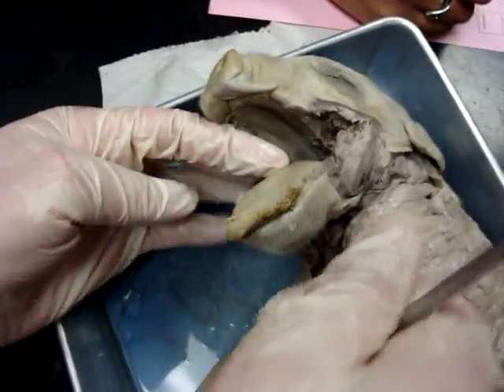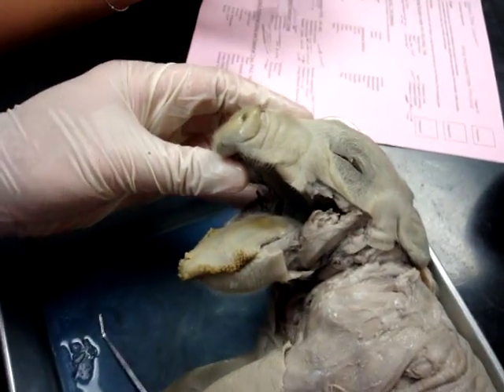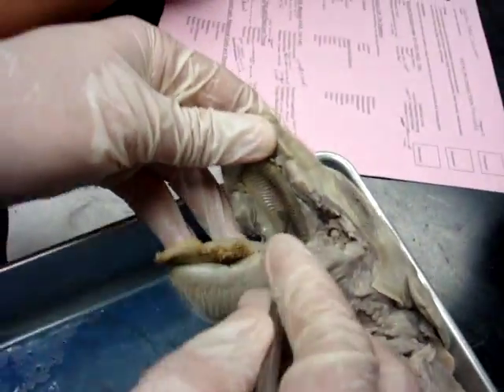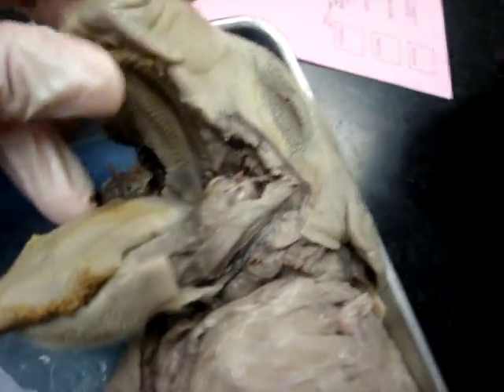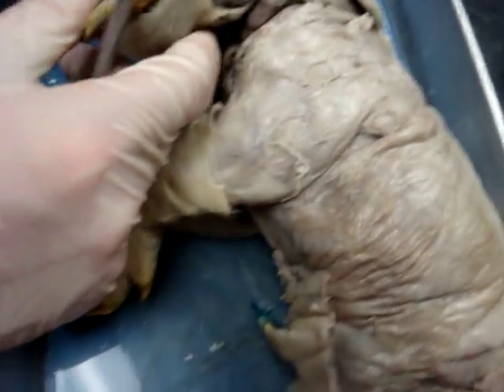Where's your tongue? I don't know. What's all that stuff right there? These things are called... fungiform papillae. Fungiform papillae — that's exactly what they are; they're really gross looking. Show me your hard palate. Show me your soft palate. Back further behind it — show me your nasopharynx, it's underneath the soft palate. We cut away some. Very good.